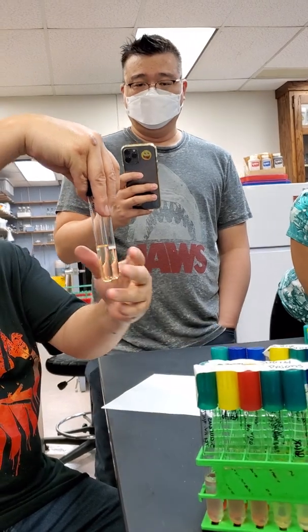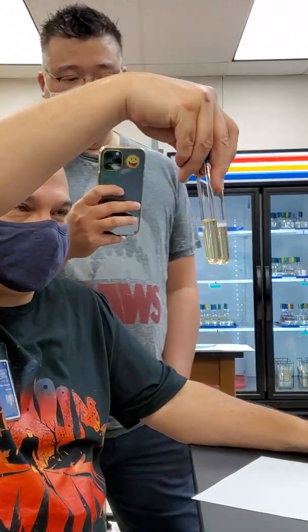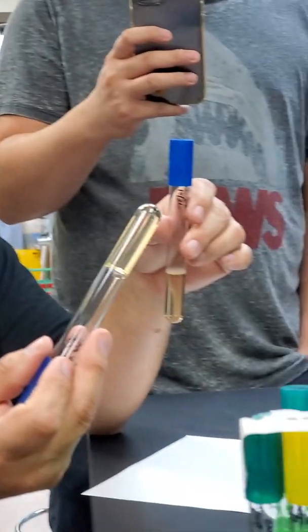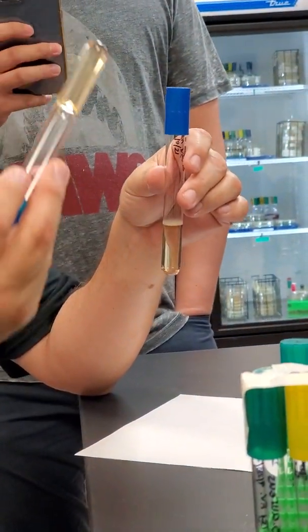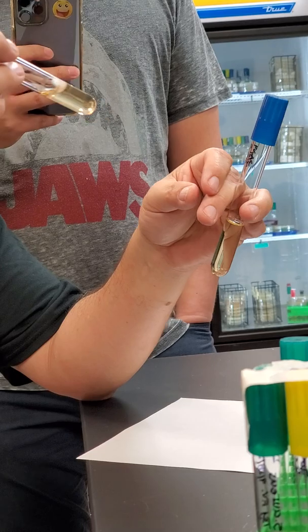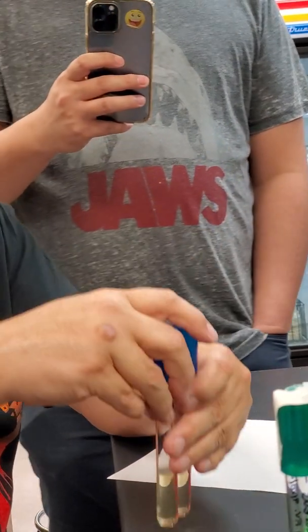The other one's really easy. You might be able to tell already which one is positive if I just shake it a little bit. Which one's positive? This one right here. The organisms are put in here, but it did not. Don't do this unless you know what you're doing. This one, it repolymerized. This one, I'm not going to do that because it'll fall and get me all dirty. But this one's completely liquid. See? Any liquid is positive.